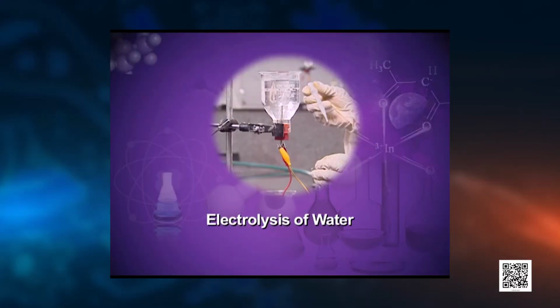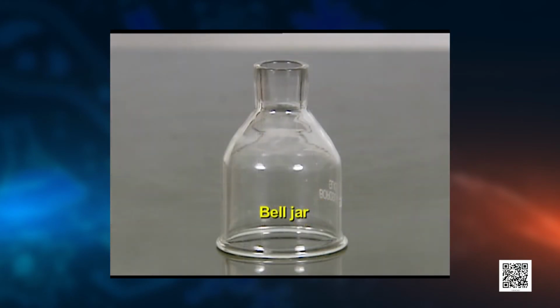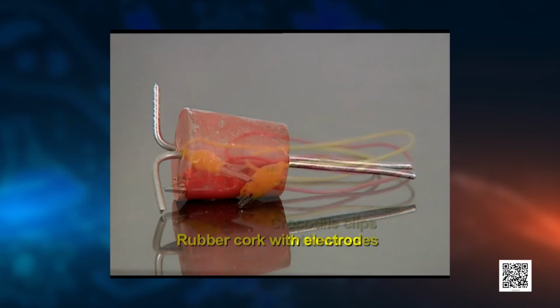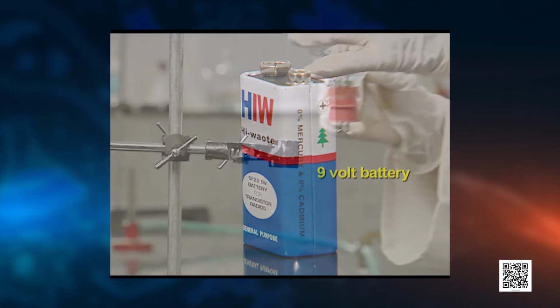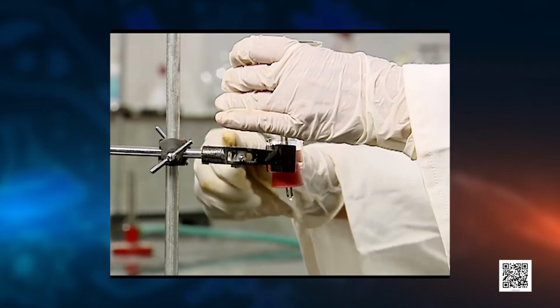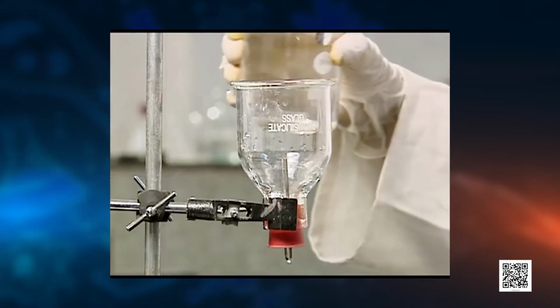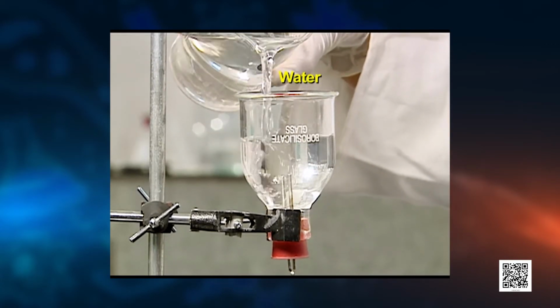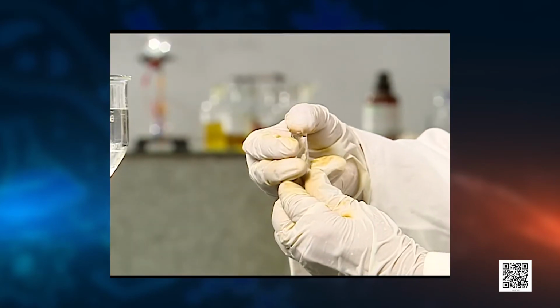Let's watch this video. What's happening in this video? For this experiment, the materials required are a stand, a bell jar, boiling tubes, a rubber cork fitted with 2 electrodes, crocodile clips with wires, and a 9-volt battery. Here, the bell jar has been shown with a rubber cork fitted with 2 electrodes. First, we have to fill water in the bell jar. When we put water in the bell jar, care should be taken that the electrodes are immersed in it properly.